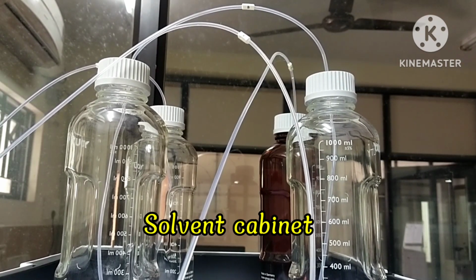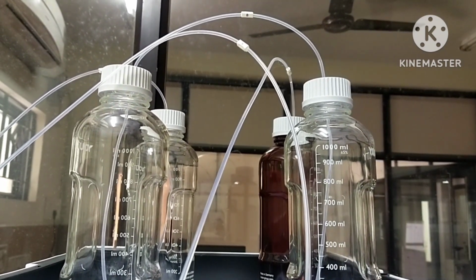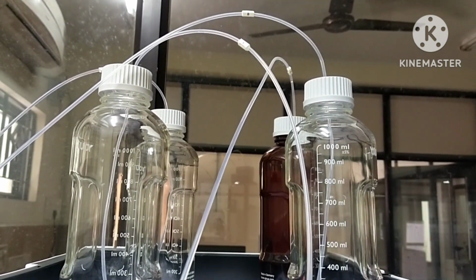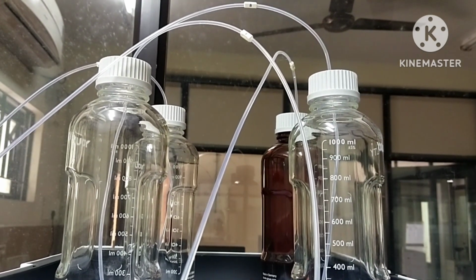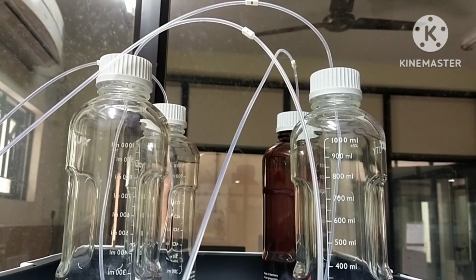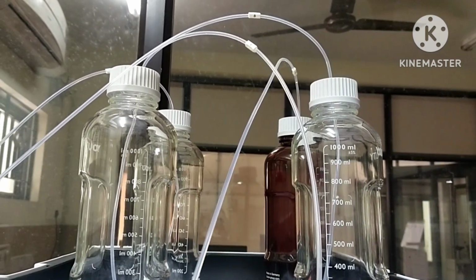Let us see the components of HPLC. This is the solvent cabinet. The solvent cabinet is a case to keep 4 bottles with a solvent standing frame. An HPLC system begins with the solvent reservoir, which contains the solvent. The solvent should be filtered with an inlet solvent filter to remove any particles that could potentially damage the system's sensitive components. Here, 4 solvent glass bottles or solvent reservoirs are present for isocratic or gradient analysis for rapid method development and also to speed up preparation of mobile phases and flushing the HPLC system. They can be connected by solvent tubings to the LC system.